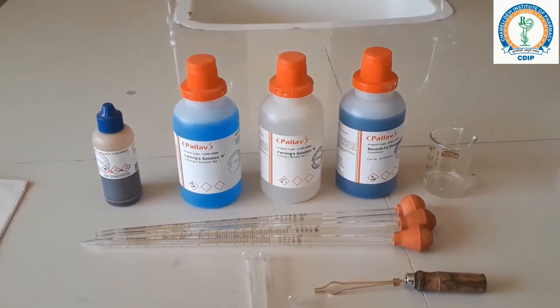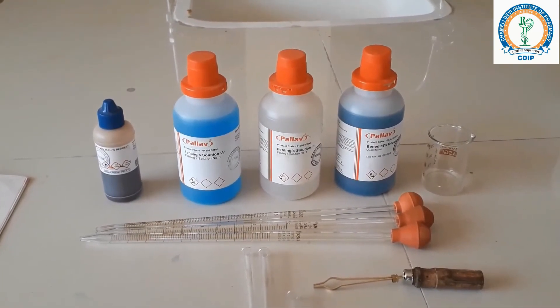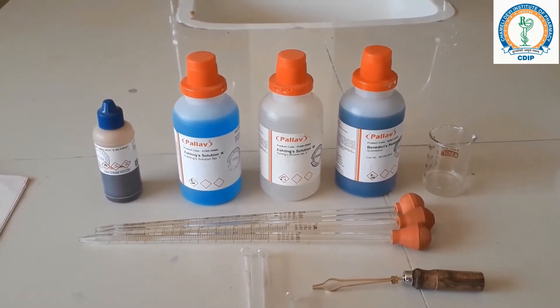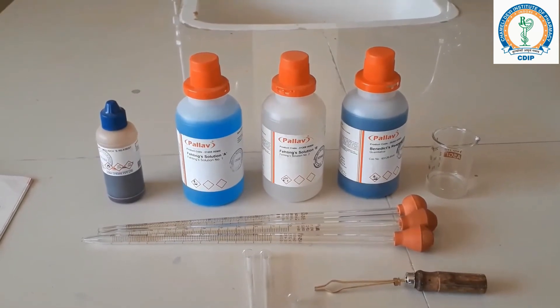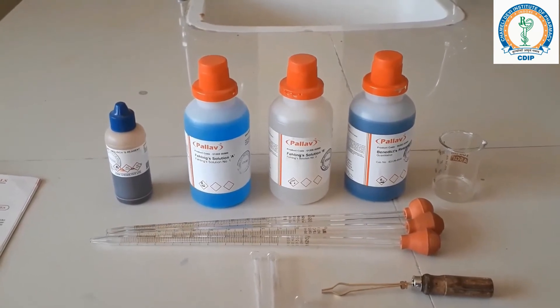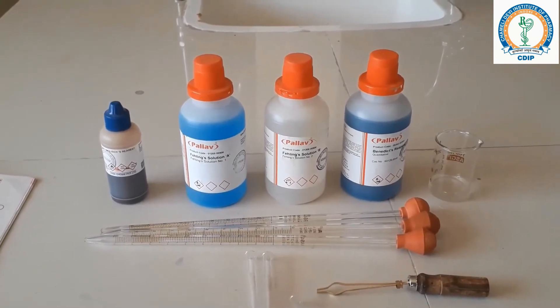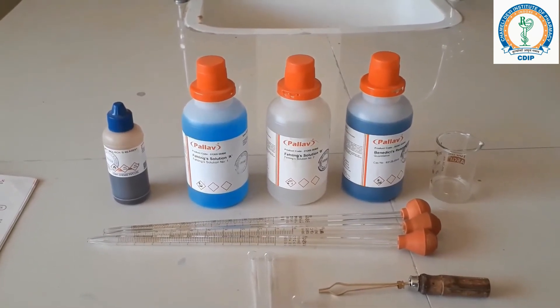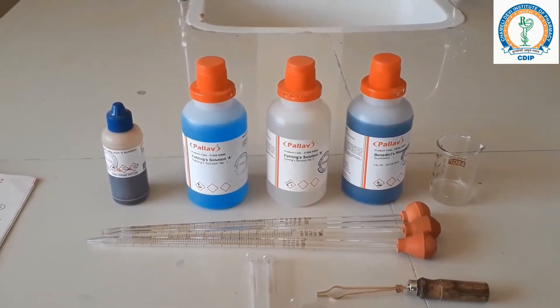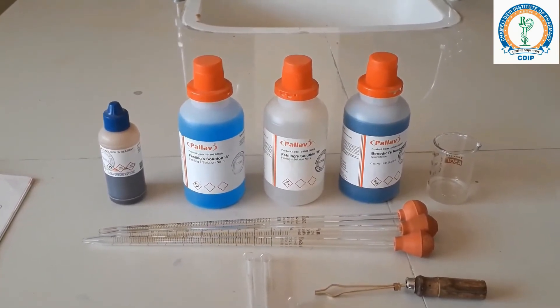We will perform the Molisch test. The principle of this test is: sugars undergo dehydration in the presence of non-oxidizing acids like hydrochloric acid and sulfuric acid to form furfural or hydroxymethyl furfural. These compounds can react with alpha-naphthol or phenol to give intensely colored compounds. This reaction forms the basis of a general qualitative test for sugar.